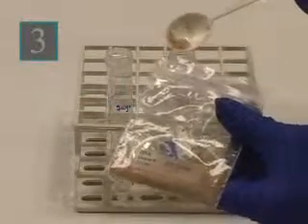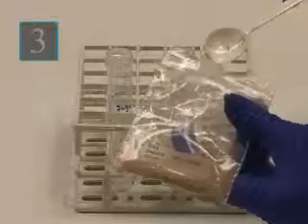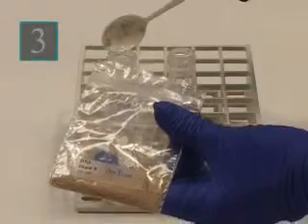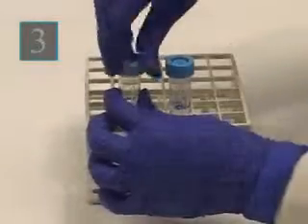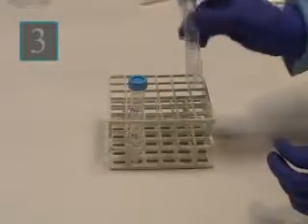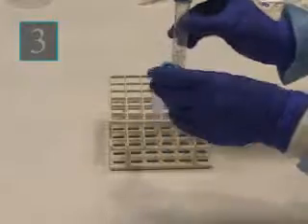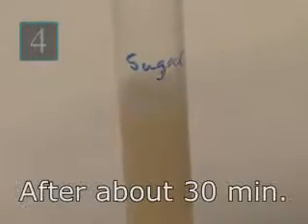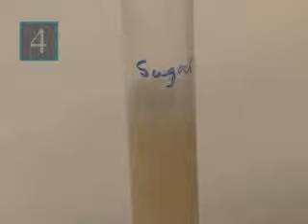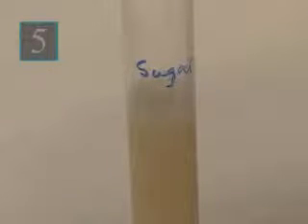Add 1 pinch of dry yeast to each of the 2 test tubes. Cap the tube and invert the tube to mix. Do not shake. Loosen cap and observe bubble formation after 5, 10, 15, and 30 minutes. Which of the test tubes produced bubbles? Repeat the experiment by increasing or decreasing sugar and/or yeast. Is there a change in the bubble formation? Why is there a change?